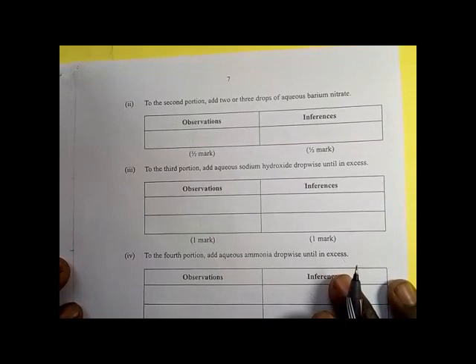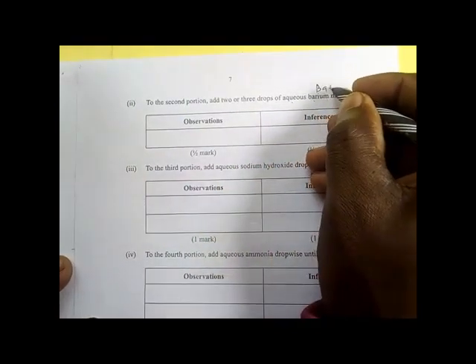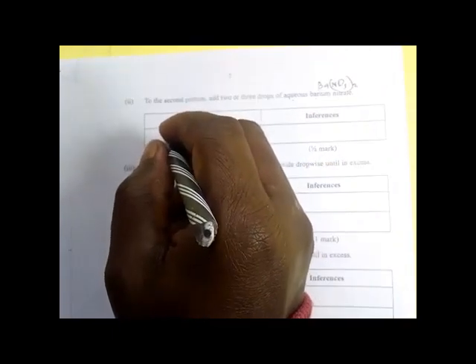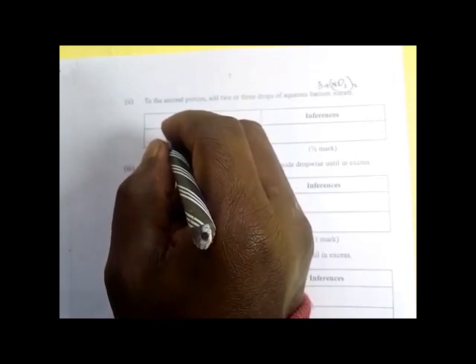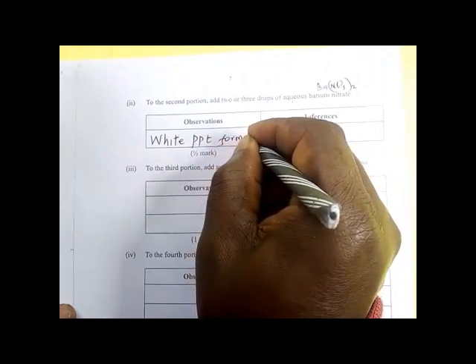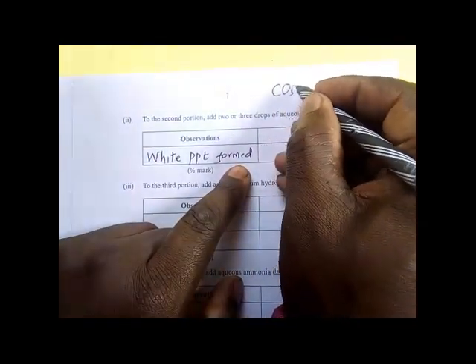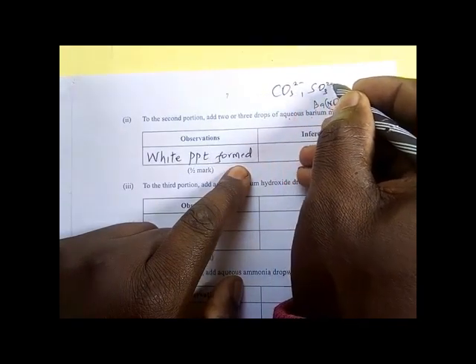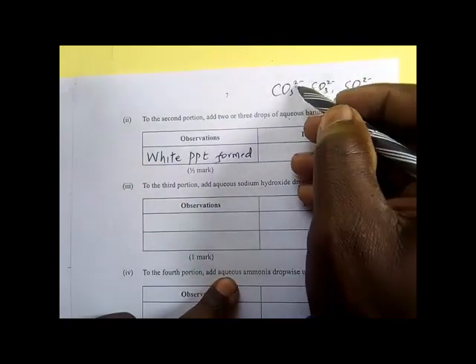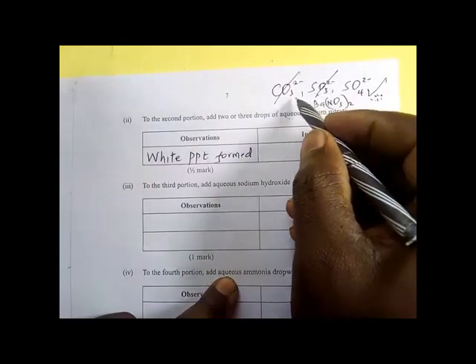To the second portion, add two or three drops of aqueous barium nitrate. The observation is that a white precipitate is formed. When barium nitrate is added, we expect white precipitates with carbonate, sulfite, or sulfate. But since from our previous test we said there is no carbonate and no sulfite, therefore what is present is the sulfate.